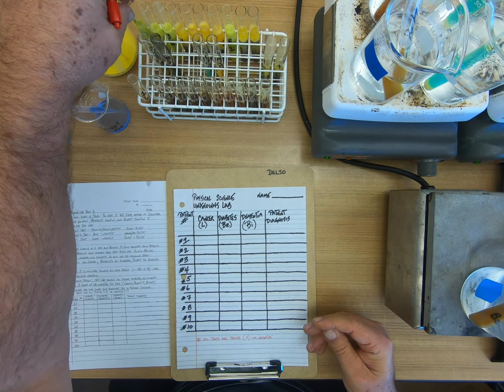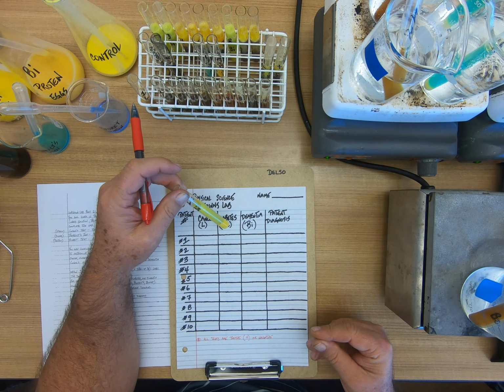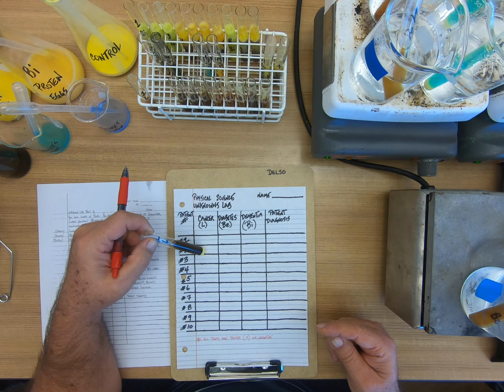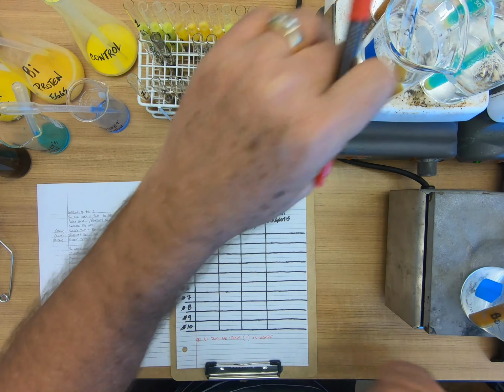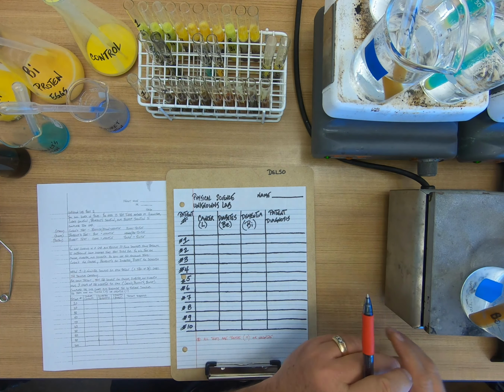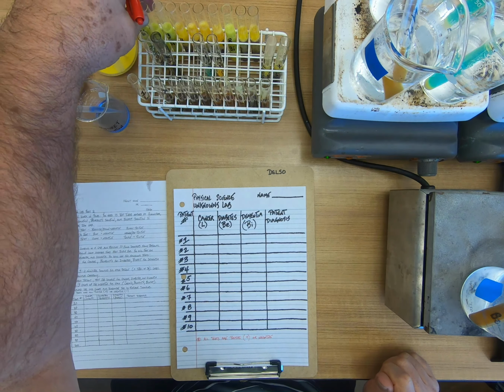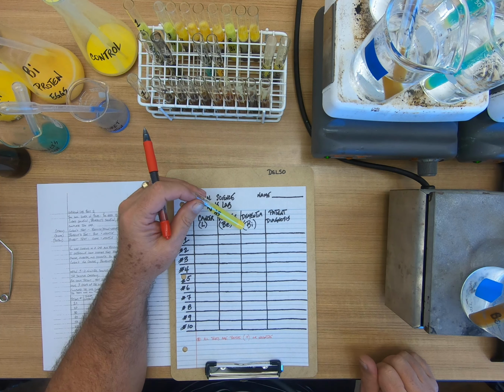And this is their Biuret test. Okay? All right, we got that one. That's number 1. Number 2 for Lugol's, that's the cancer. Number 2 for diabetes. Number 2 for Biuret's or dementia.